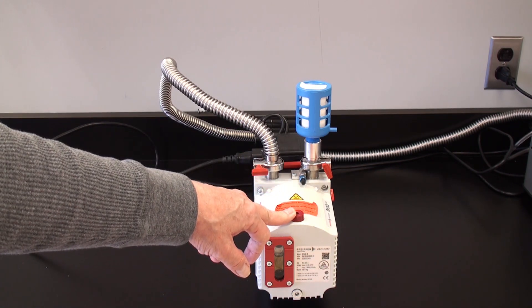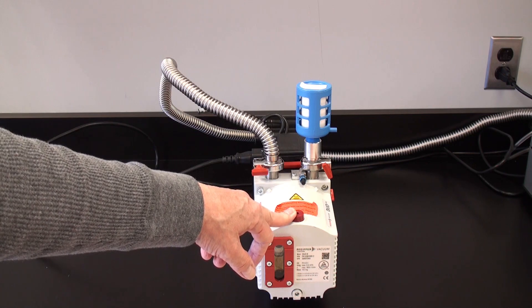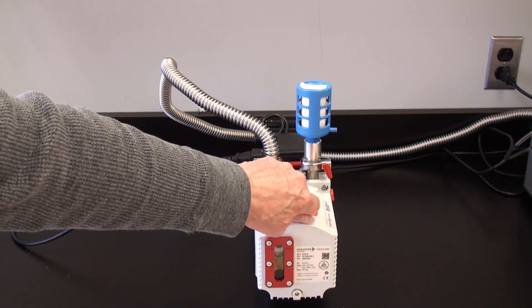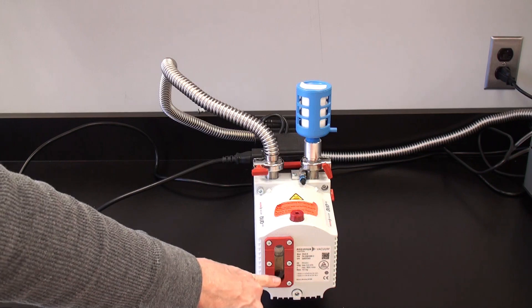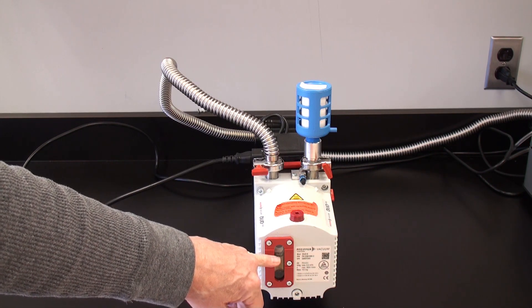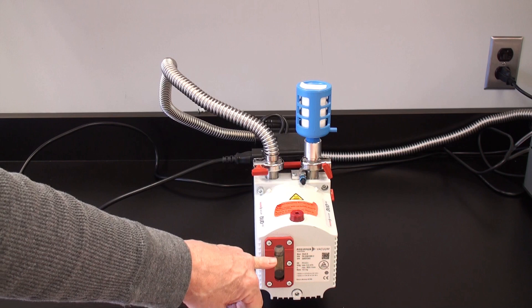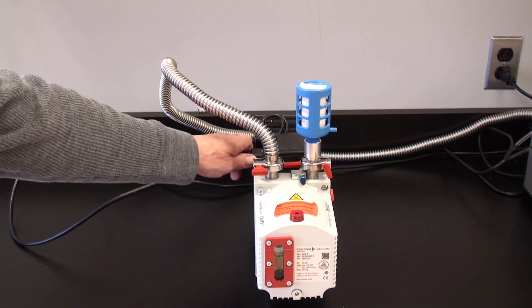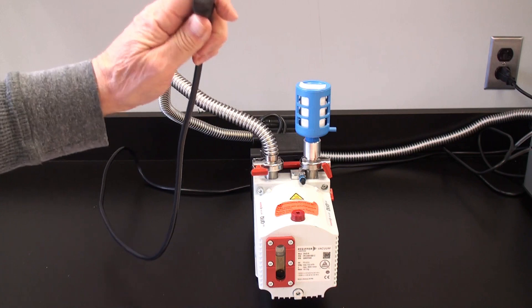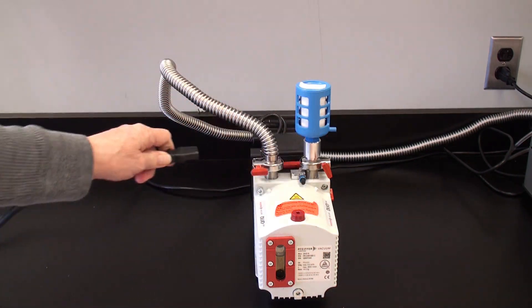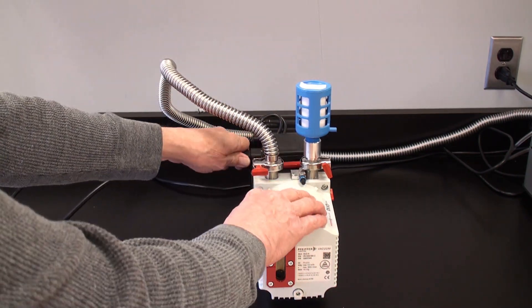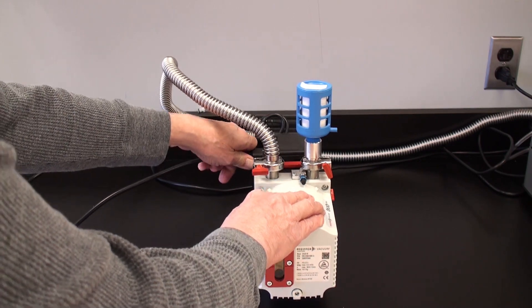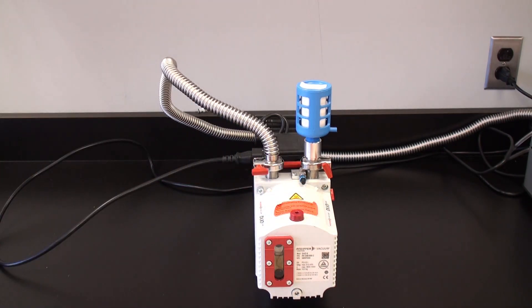Oil is added into the Duo 6 pump via this cap which just unscrews, and you fill the oil somewhere between half to two-thirds and you can visualize the level of the oil through the sight glass. Again, the modular line cord goes from the MiniQS special plug to the plug receptacle on the Duo 6 pump. If you purchase a different pump with the system, the setup might be somewhat different.